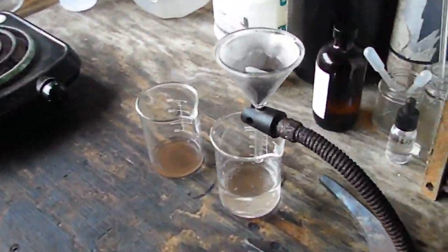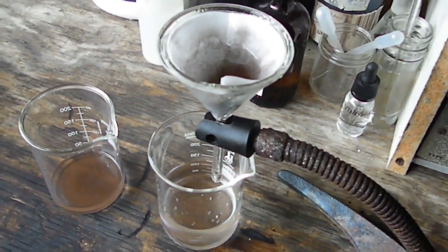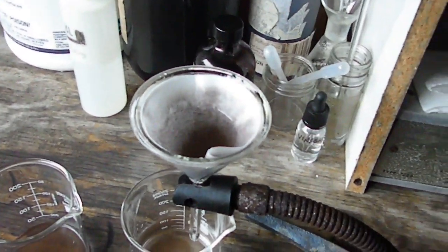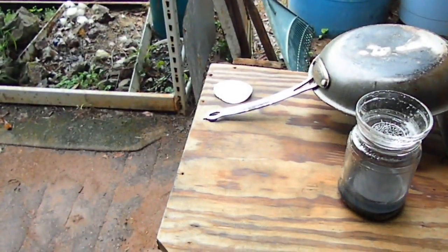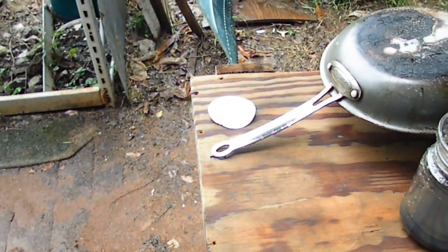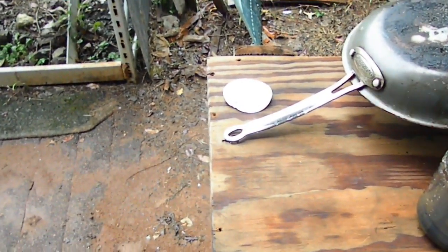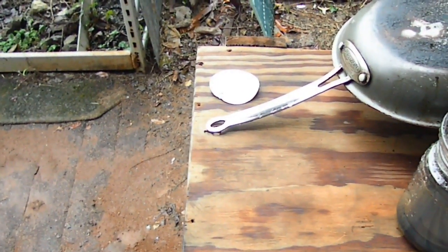I will melt these buttons together after I get it all done and do a weight, then I'll take my cut out of that button. I'll hammer it out again and purify it. I'm thinking the contaminant might actually be palladium — I'll know when I melt it because if it sparks a little bit, there's palladium in it. I just wanted to show you that powder must have been tin — tin chloride or lead chloride. It's not silver chloride because even though it's cloudy, the ultraviolet light still would have gotten through. You can see the filter paper is still white; if it was silver chloride, it would have turned purple. So, just junk.